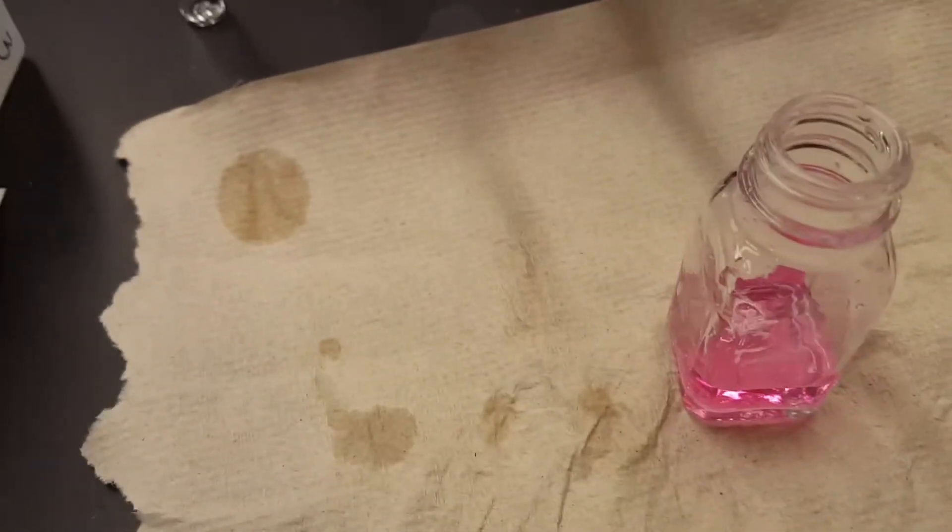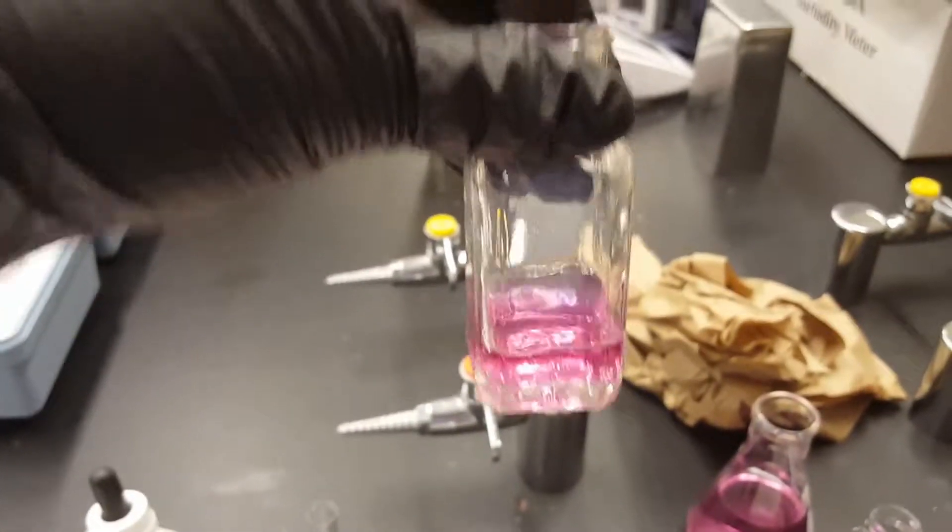So I'm going to put in one drop and I'm going to swirl. And you're going to continue doing that until it turns blue.